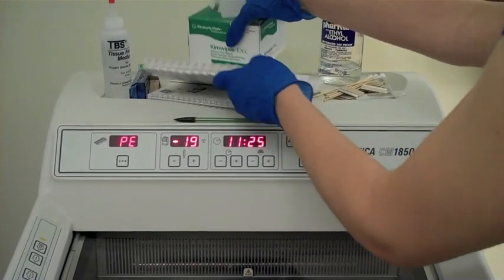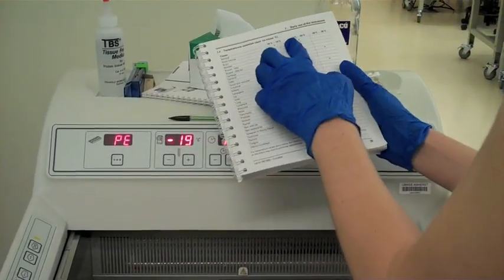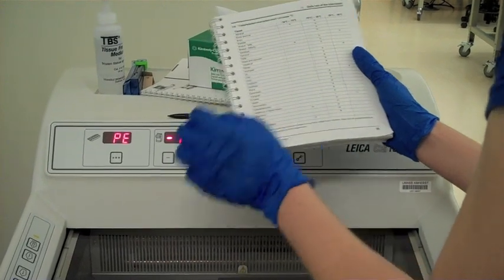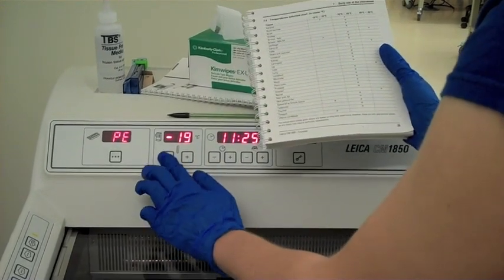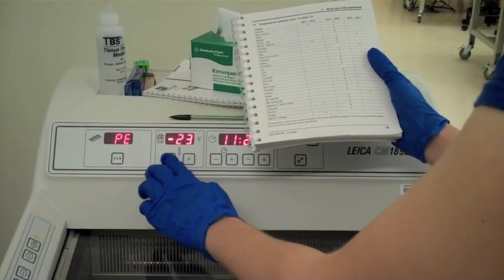Consult the handbook on the top of the cryostat to set the machine to the appropriate temperature for your tissue. Generally, this should be near negative 20 degrees Celsius.